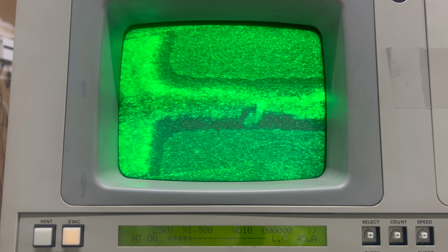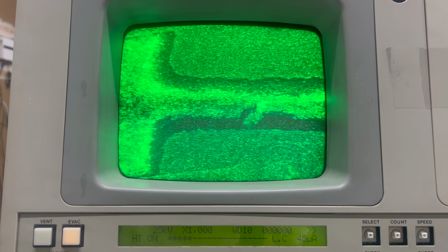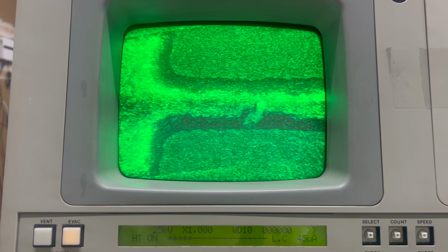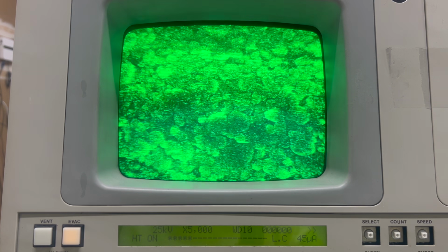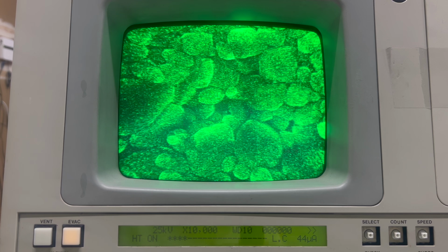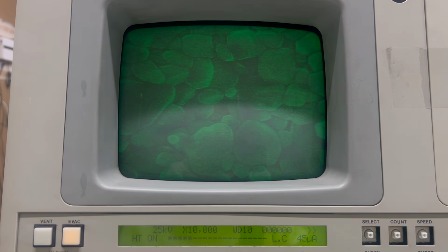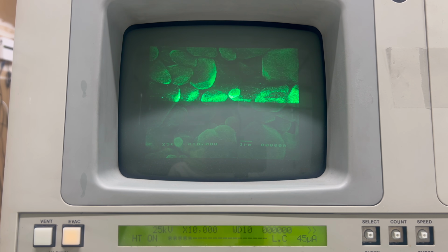I found some traces on my chip that were covered in this extremely fine particulate. At 1000 times magnification, the limit of an optical microscope, you can just barely make it out. If we zoom in further, it becomes super obvious that this layer isn't smooth at all, but is instead made up of tiny little particles. Let me enable slow scan and bring up the measurement bar. You can see that these particles are about 1 to 5 micrometers in diameter.